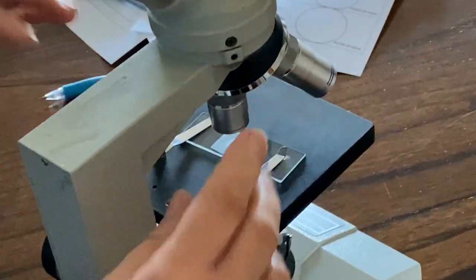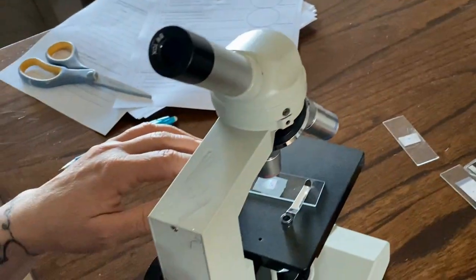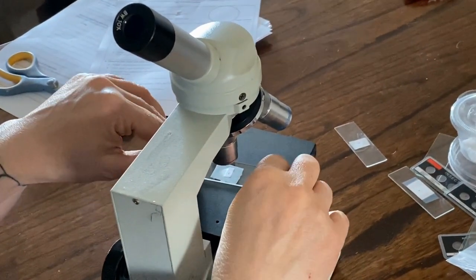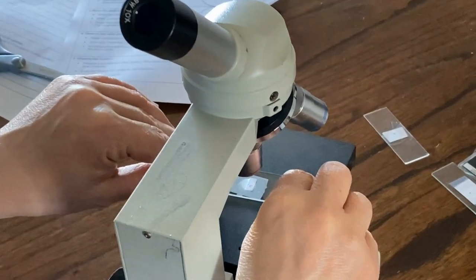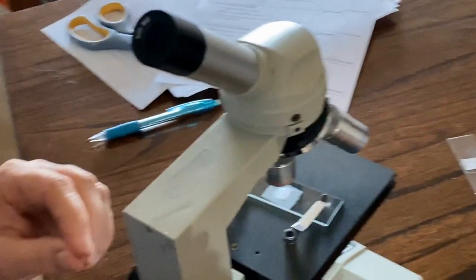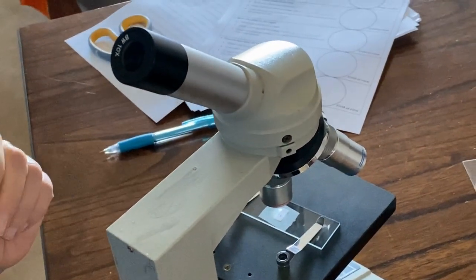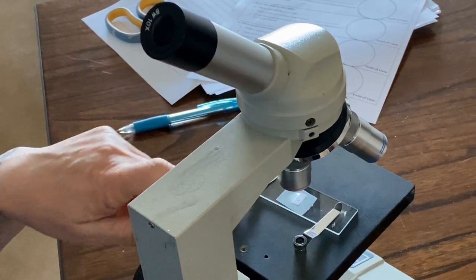It flips it, and this is what makes it difficult, because if you see something that's wiggling away from you, you don't want to try to follow it by moving the slide that way. You want to go the opposite direction. So if you find a little organism and you're trying to follow it, you actually have to move the slide the opposite direction. It makes it really, really hard to do. So that's the first thing you want to do.